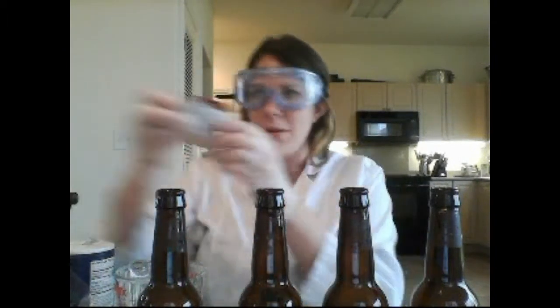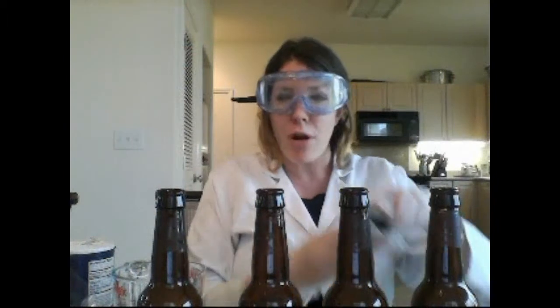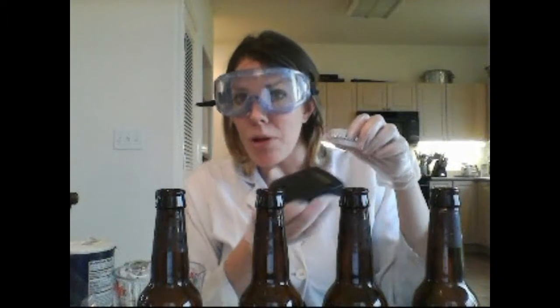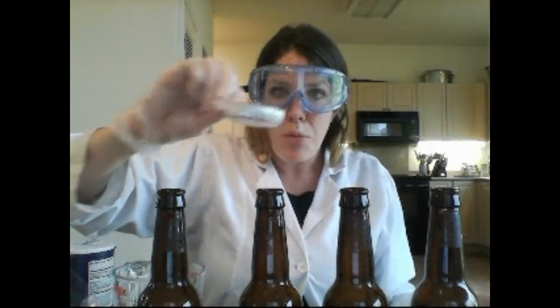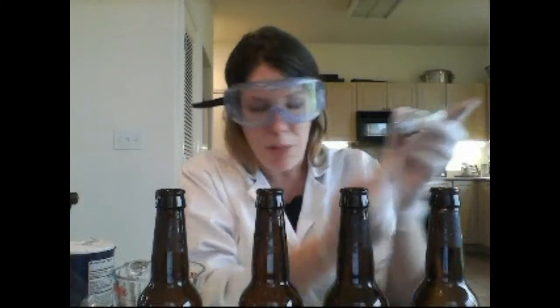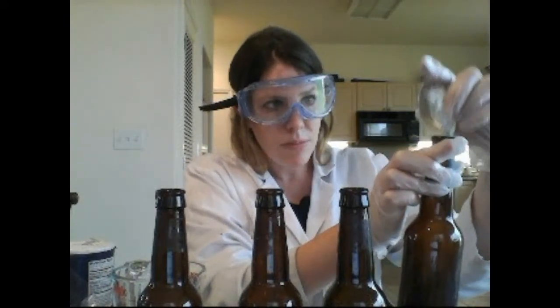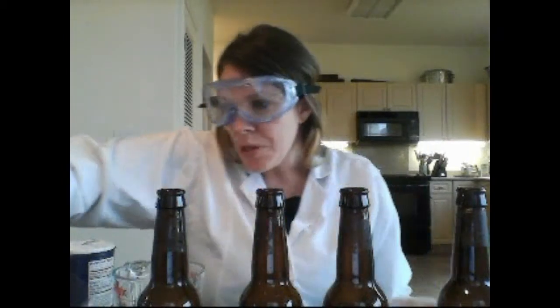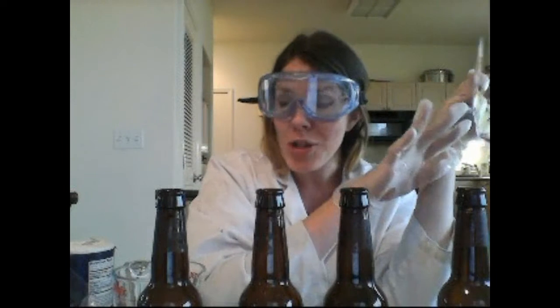Let's go ahead and get started. We're going to need to measure out four sets of seven grams of dry active yeast, which you can buy in the grocery store. You're going to need your digital scale and a weighboat. Put the empty weighboat on the scale, tare it, and weigh out seven grams. Note that each packet says it's seven grams, but that's not always accurate, so you do want to actually weigh it out into your weighboat.